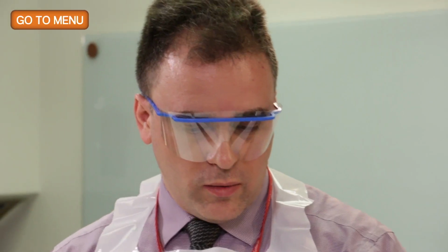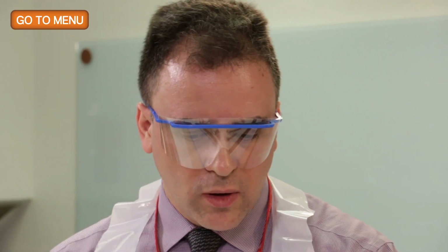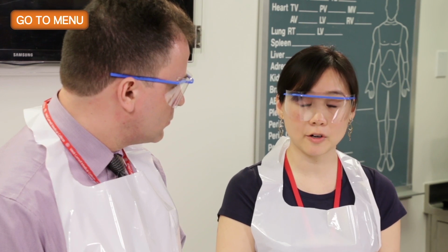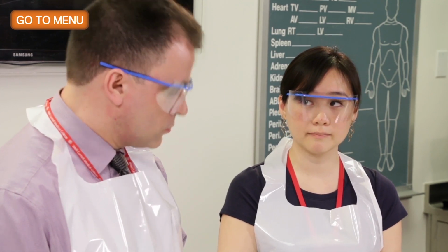And as we begin to think about actually looking at this particular specimen, was there one nodule or were there multiple nodules, and why would that matter? It was a single nodule, and it's very important to actually realize if there are multiple, because it could be multiple primaries or it can actually be intrapulmonary metastasis, which will change the staging.